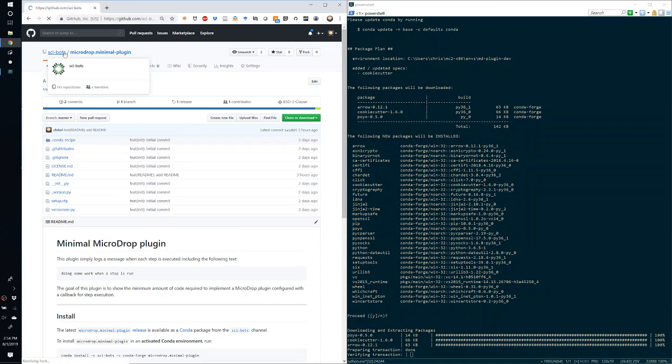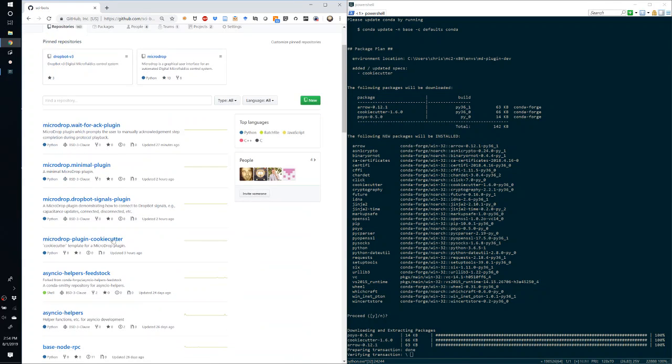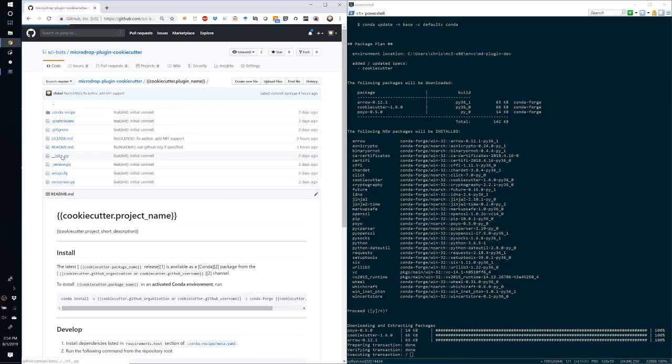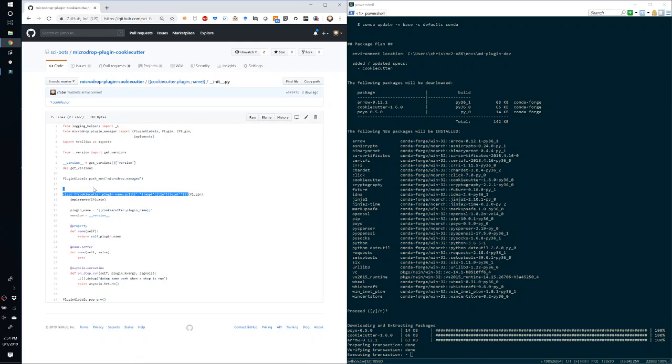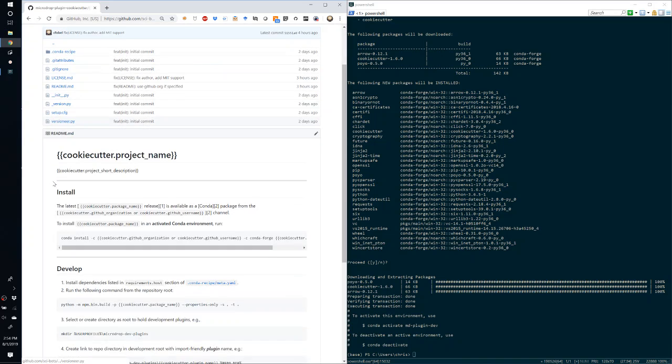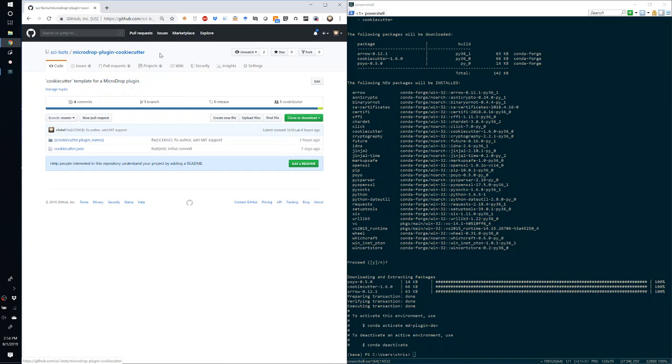And we're going to use that cookiecutter package to customize a microdrop plugin template for cookiecutter, where the contents of this template are very similar to the minimal plugin example we were looking at, with the exception being that some locations in this template have corresponding Jinja variables that will be expanded when the template is rendered. And so the idea is that this can be used as a base plugin template to develop your own custom plugins. Okay, so the environment has been created, so let's activate it.